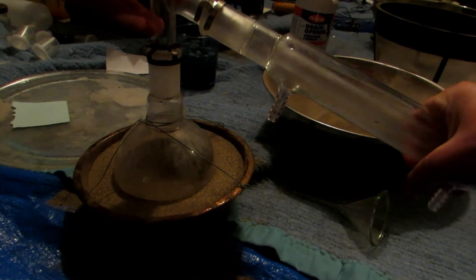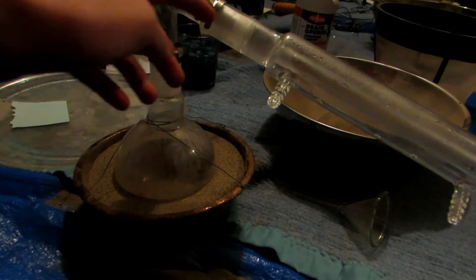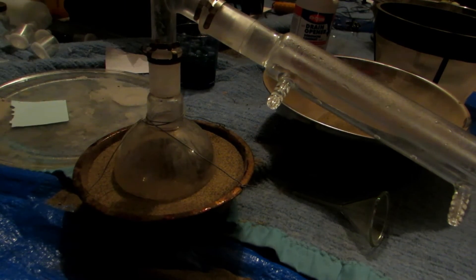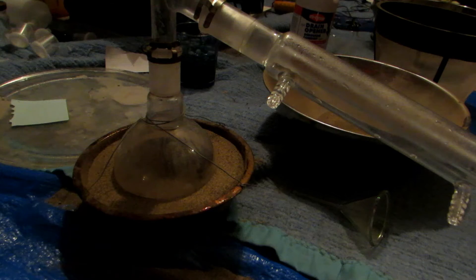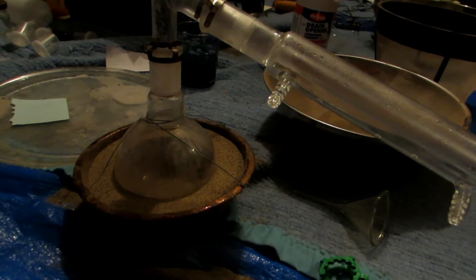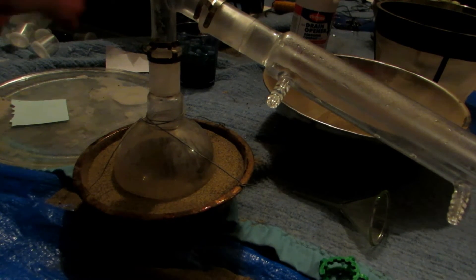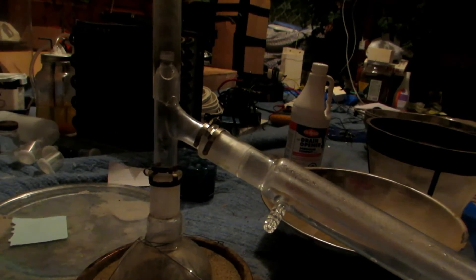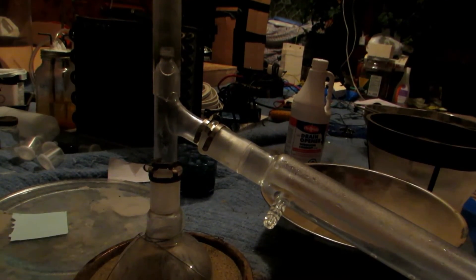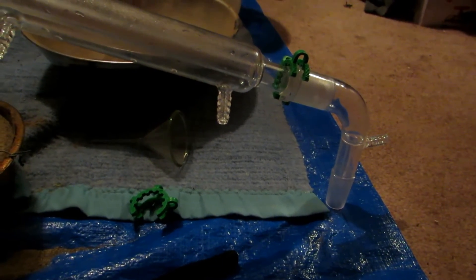I have several projects planned if we can get pure sulfuric acid. Any keck clips used near the heat must be metal — the plastic ones will just melt right off. I'm going to grease all the joints with sulfuric acid, grease the top part with sulfuric acid, fill the round bottom flask to about 250 milliliters of sulfuric acid, and set up the receiving flask on this end.